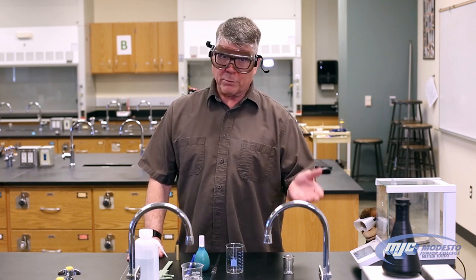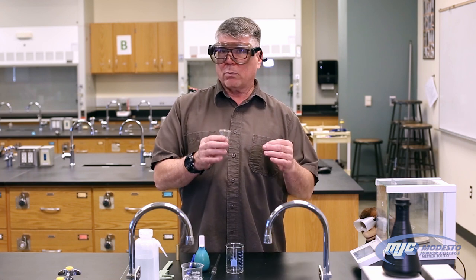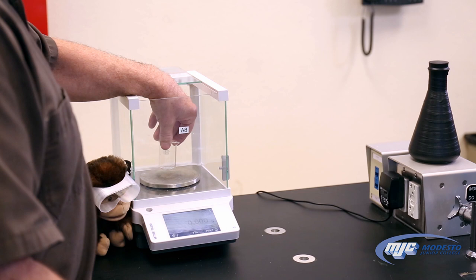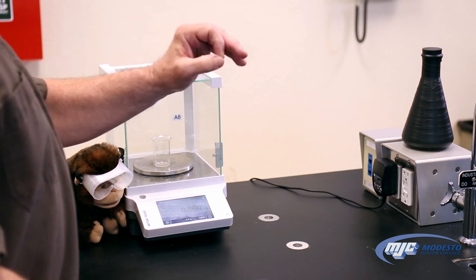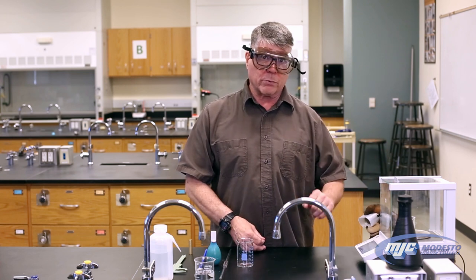This is the first part of the density experiment. All we're going to do is measure the mass of 10 milliliters of DI water five times in a 30 milliliter beaker. We don't care how much the beaker weighs, so we use the tare function — T-A-R-E — on the balance, which subtracts out the mass of the empty beaker. We open the balance, place the beaker on the pan, close the doors, press T for tare, and now the balance reads 0.000 grams. These balances always give three places past the decimal, so it's important to record all of them.